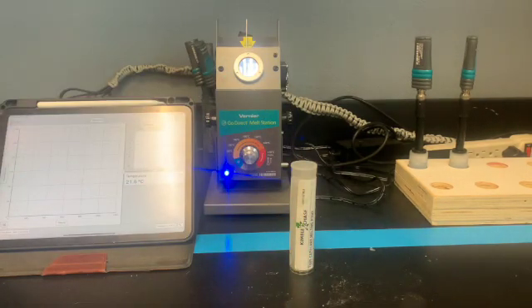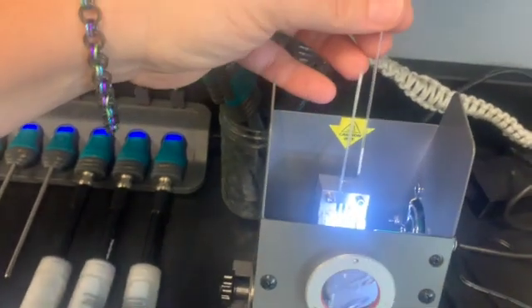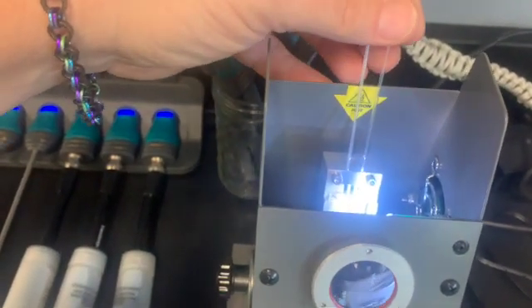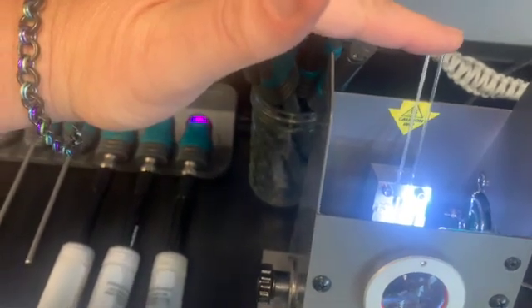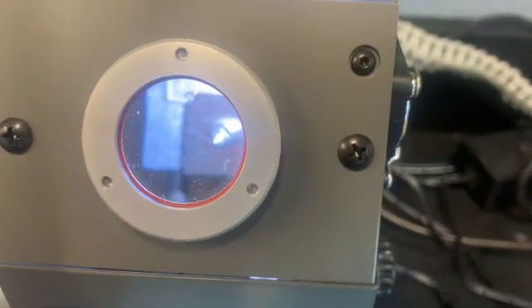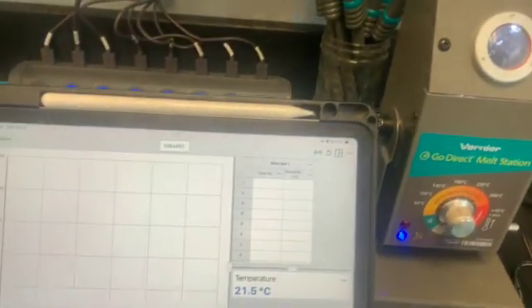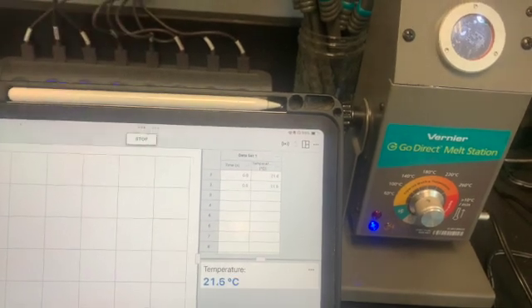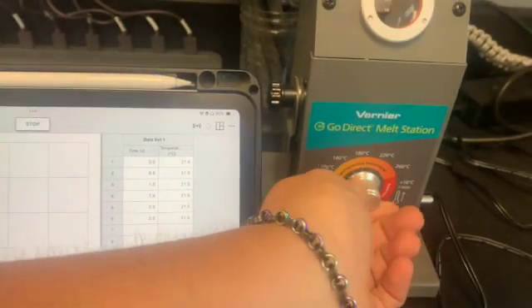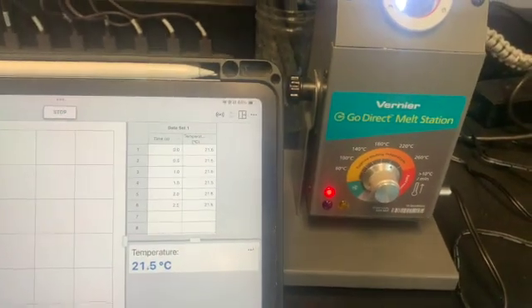So when I have that done, there are 3 holes back here. I don't know how well you can see that, but I'm going to split these 2. So I have 2 going at the same time. We're going to be looking through here, and this is what we're going to be watching as we start heating up. And so if we're ready, we're going to start collecting. And now I start heating, and I'm not going to go over 220. That is really what we're going to max out at.